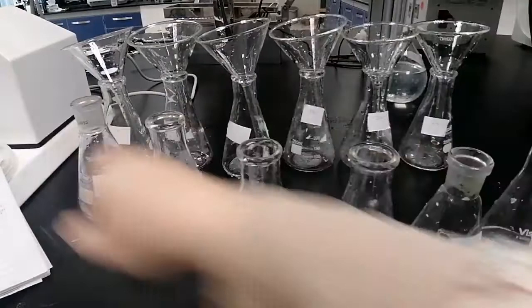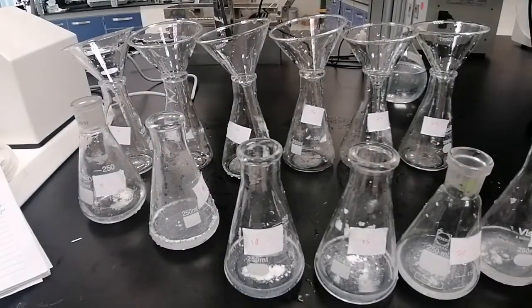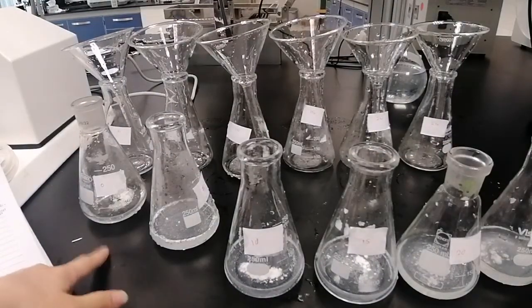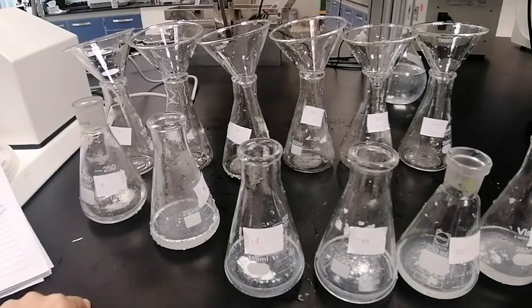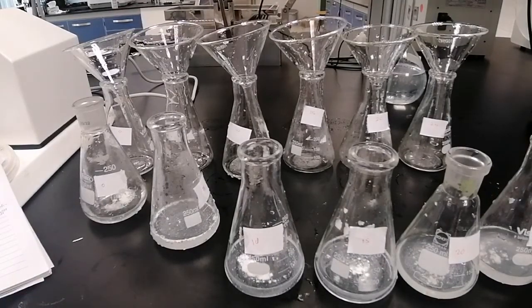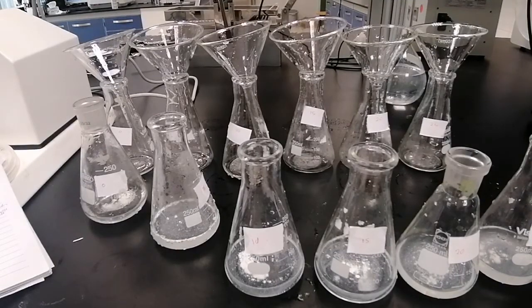Then we will use 1 ml of filtrate and dilute it up to 100 ml with sodium hydroxide, and then measure the absorbance. Absorptivity is well known from the previous part. It's calculated from your calibration curve, and the same will be used from the previous part. Then you will plot solubility versus ethanol concentration, taking into consideration the dilution we made after shaking and after using the filtrate.